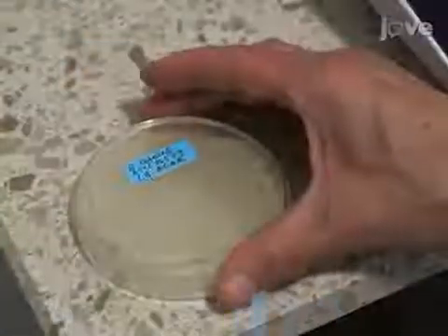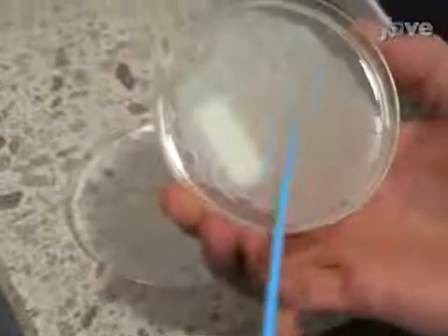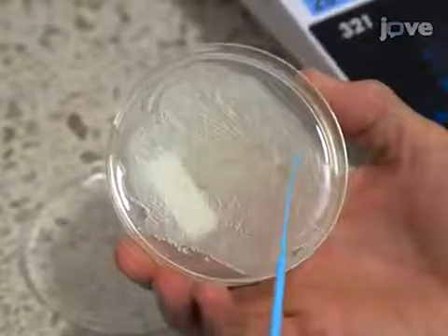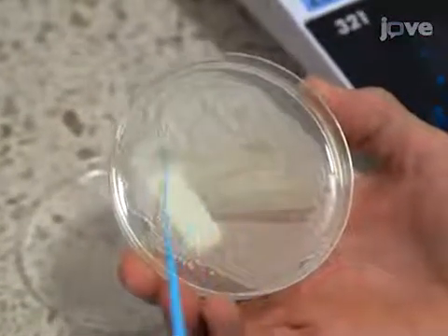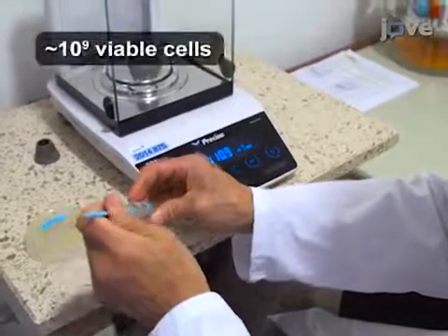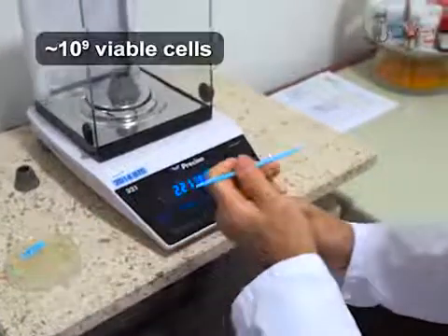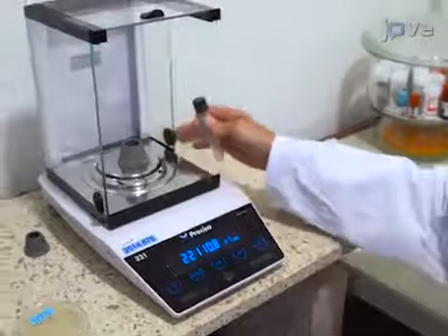In order to obtain lipid fatty acids, harvest bacterial cells by scraping colonies from the agar plate, and transferring approximately 40 milligrams into a 10-milliliter glass tube with a screw cap and PTFE seal.